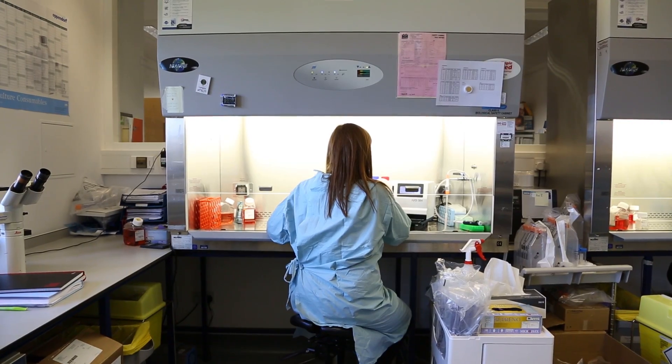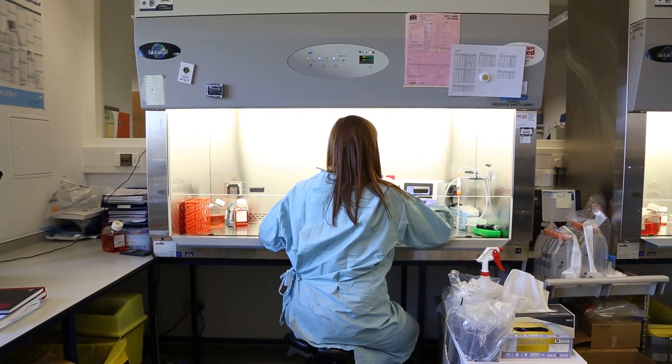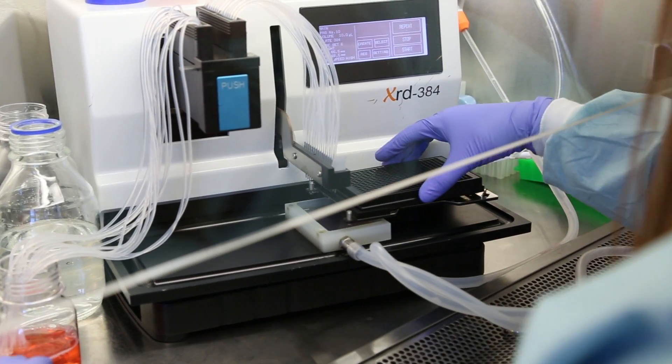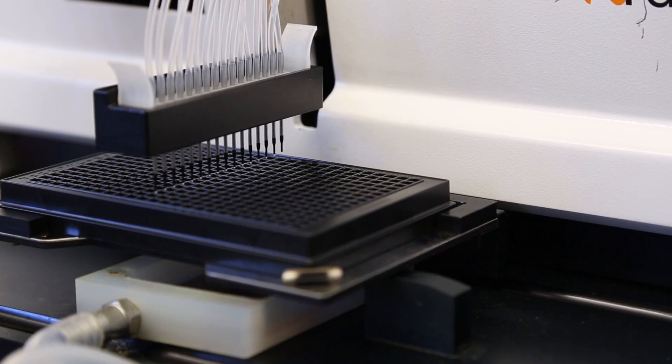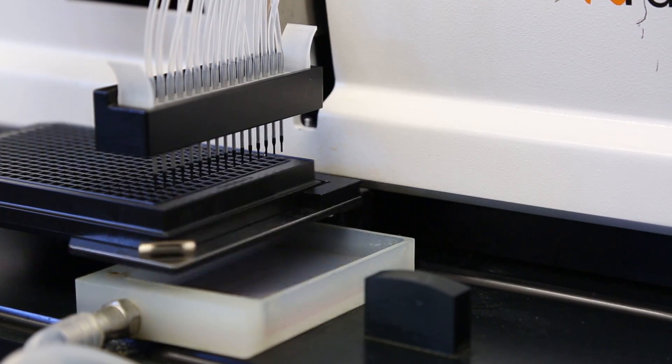The main aims of this project were to determine if a derived organoid captured all the mutations that were present in the patient biopsy that it was derived from, and secondly to determine if they were amenable to high-throughput drug screening. As we can propagate organoids to large numbers in culture, this allowed us to put them into multi-well plates, where we could look at the effect of 50 drugs at one time.